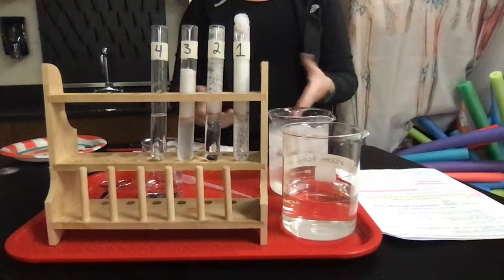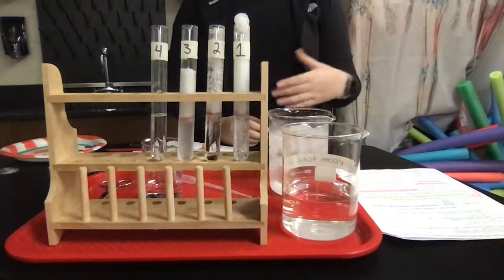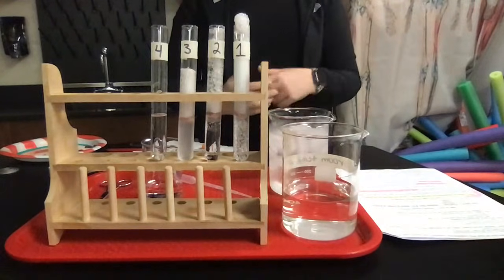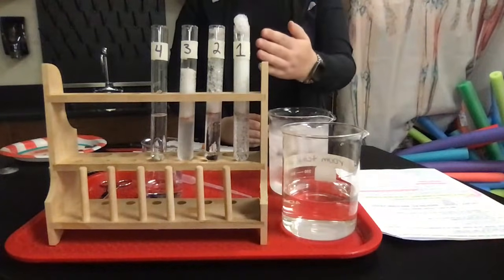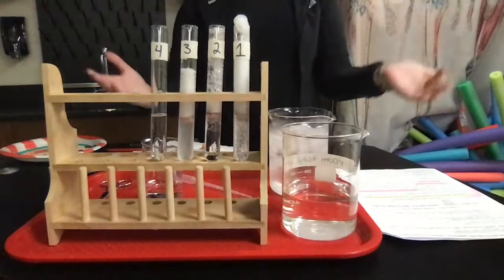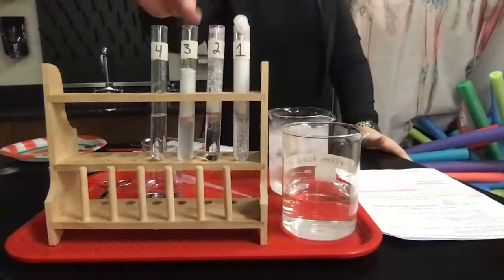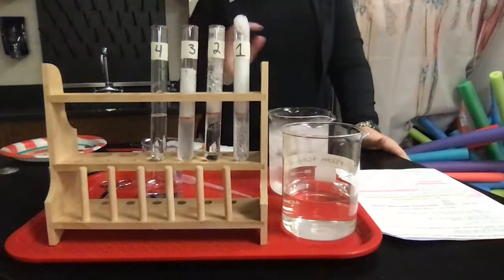So like I said, physiological temperature, that's exactly where you would expect the enzyme to have the highest rate of activity, and that's exactly what we are seeing here. And then in the second tube, where you have slightly cooler temperatures, you still see very good results here, which means that it's active at that temperature, which makes sense. It's not horribly far off from our physiological temperature. In tube 3, you see a good reaction, but you wouldn't expect that at 4 degrees Celsius. So let's talk about a few things here.